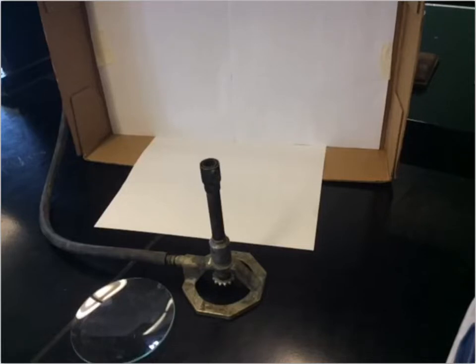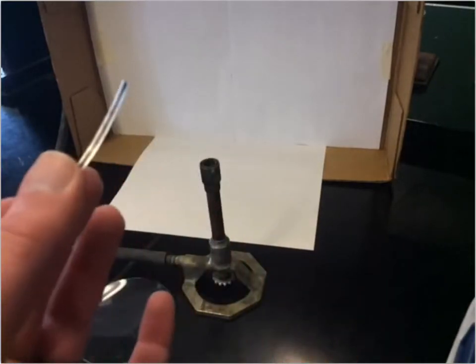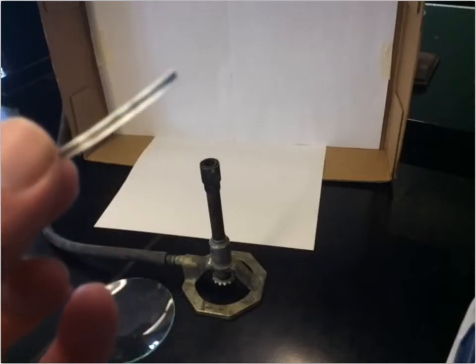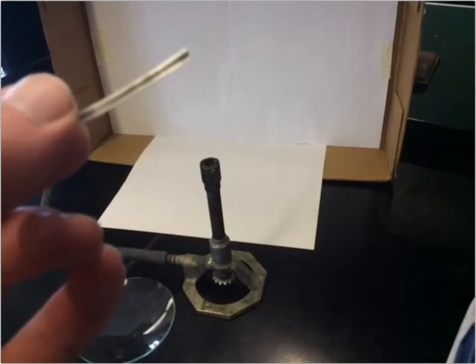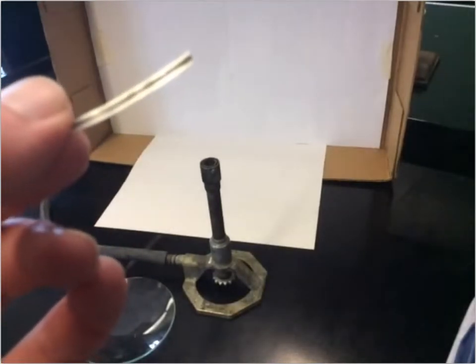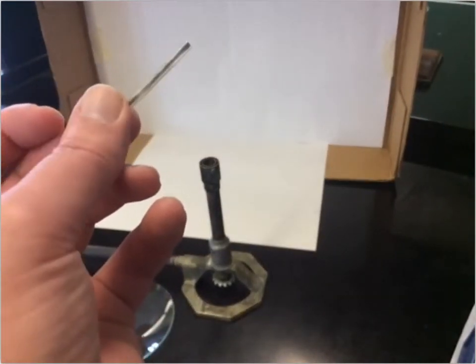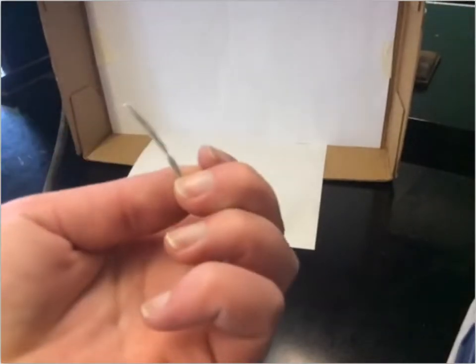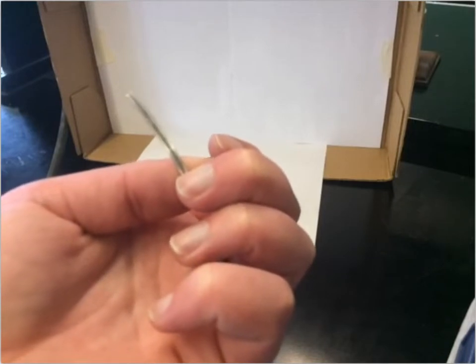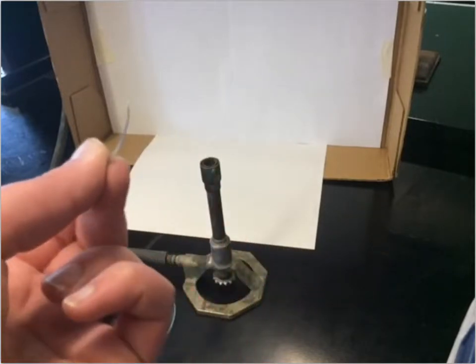The first reaction we're doing is reacting magnesium with oxygen gas. The magnesium we're using is just a magnesium ribbon. It's this shiny ribbon — it's got a dark spot through the middle where it's been a little bit rubbed.